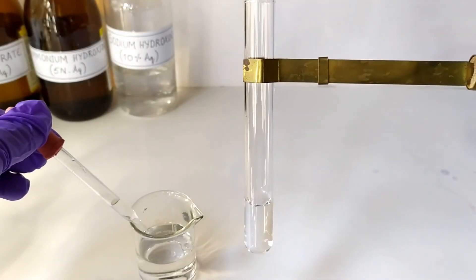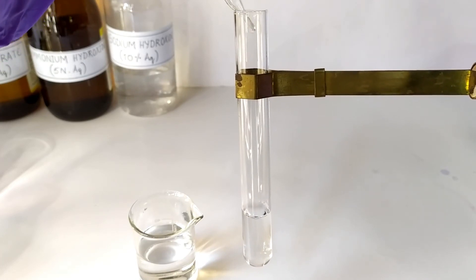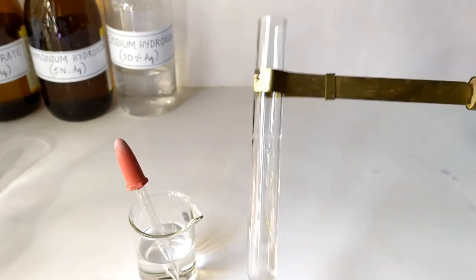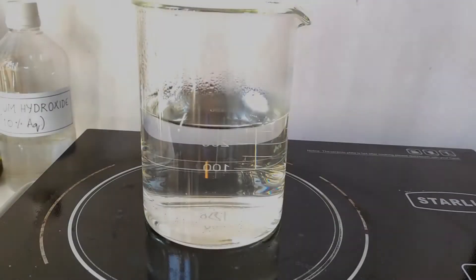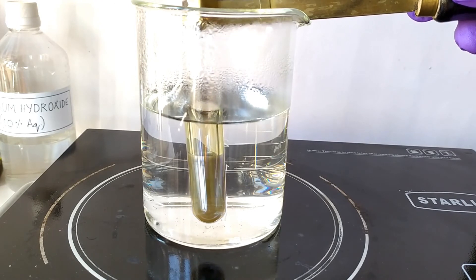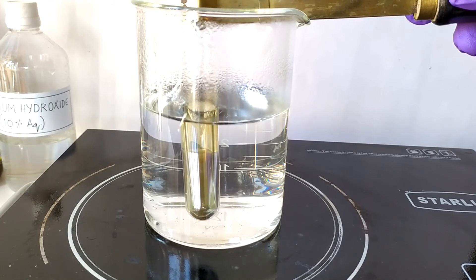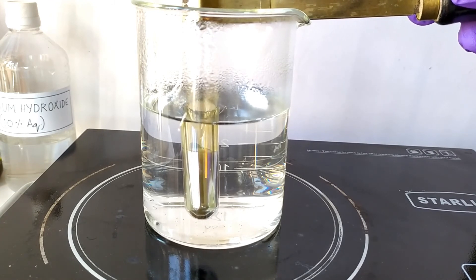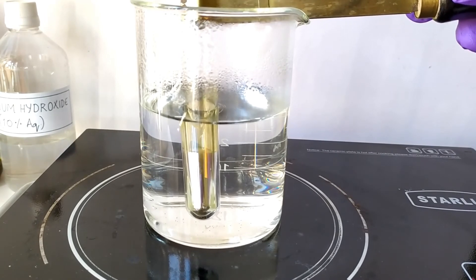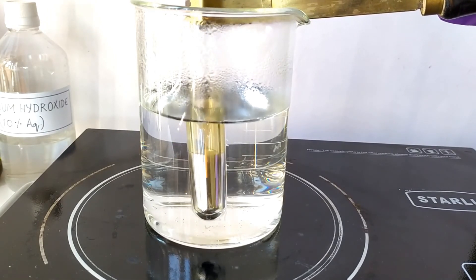To perform the Tollens test, add several drops of an aldehyde such as glucose solution to the freshly prepared Tollens reagent. Allow a minute or so for the reaction to occur, or place the tube in a hot water bath to speed up the reaction. A positive aldehyde test results in either a black precipitate or a layer of elemental silver on the inner walls of the tube. The same test performed on a ketone sample gives a negative result, with neither a black precipitate nor a silver mirror being formed.